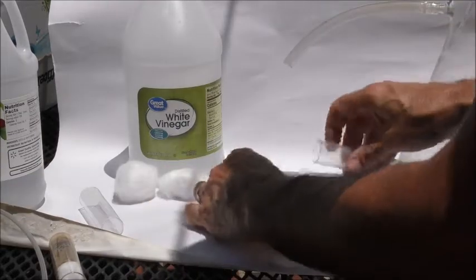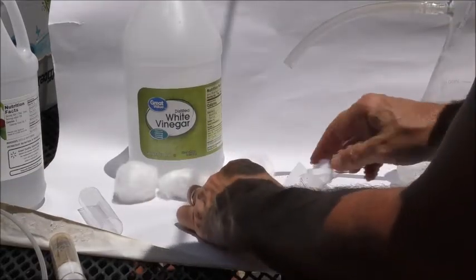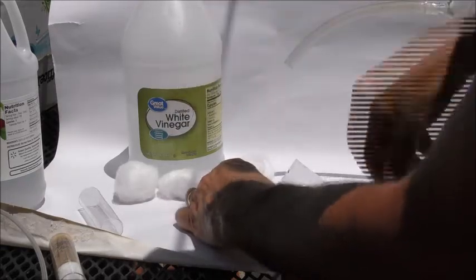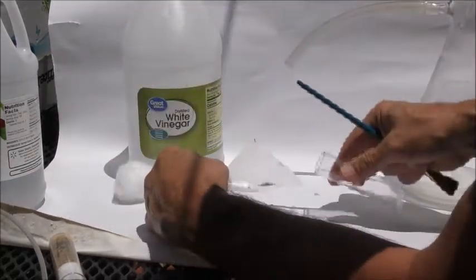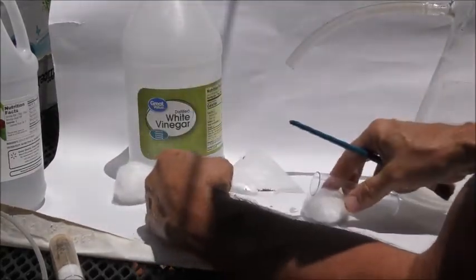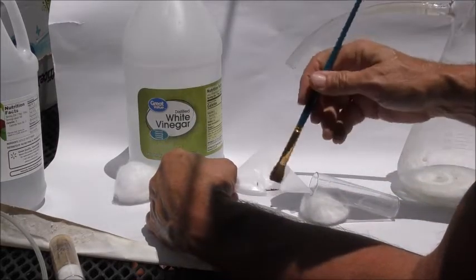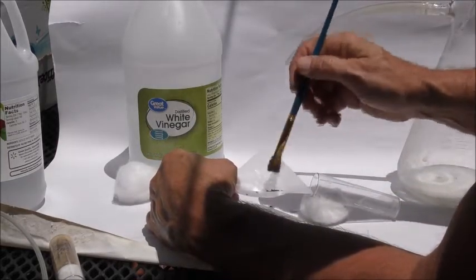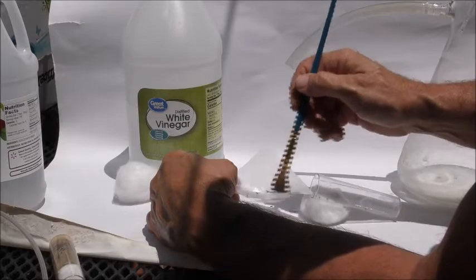If you want to know how many you want to take into another vial, it might take two people, but you can put them on some wax paper like this, and you can count the number of flies that you want to transfer over that are anesthetized.